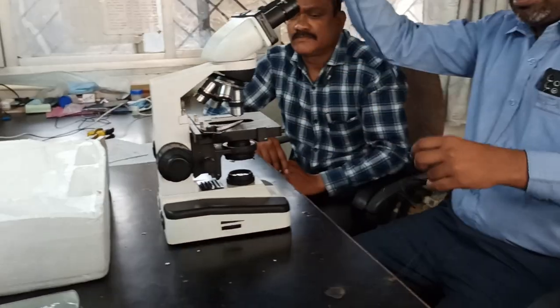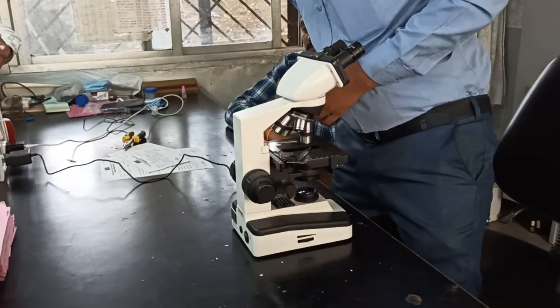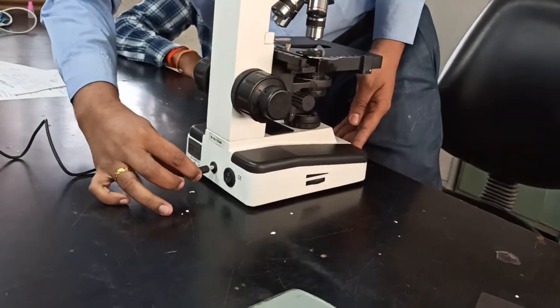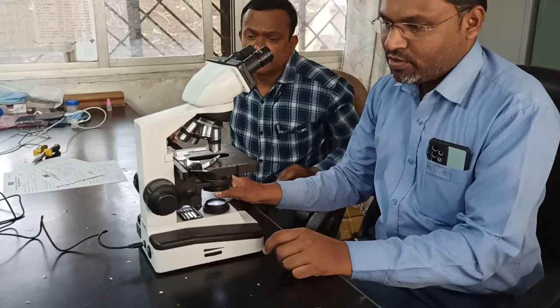At the last, this is a power adapter which is provided with the microscope. It doesn't have any battery backup, so you have to connect it to the mains for the LED. Just switch it on. Now light is coming, right? That means your microscope is working well.